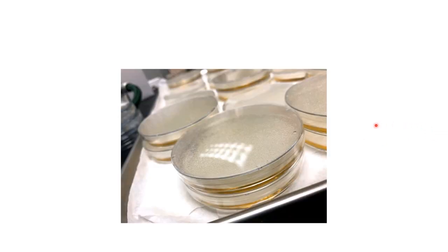Once you have them poured they're still liquid. You can tell by the golden color as opposed to the white color they were originally. They're still liquid but they need to be cold, and generally in the lab, rather than wait for them to just get cool and then go ahead and spread them, that usually makes a mess. We refrigerate them and I put them on trays and stack them very carefully. Now if you drop the tray that has everyone's agar on it, someone will get mad with you.